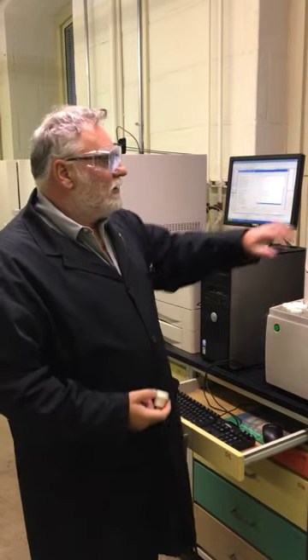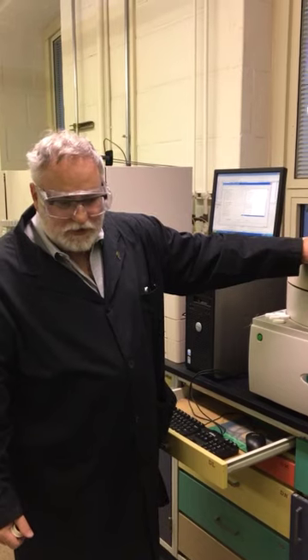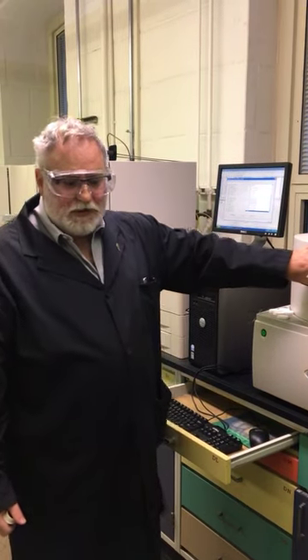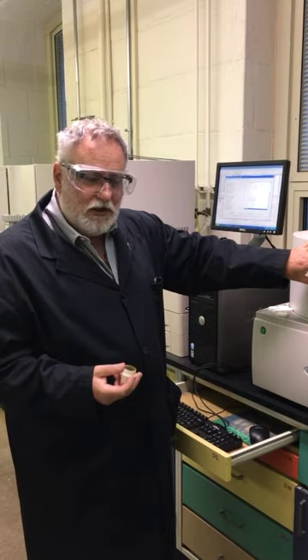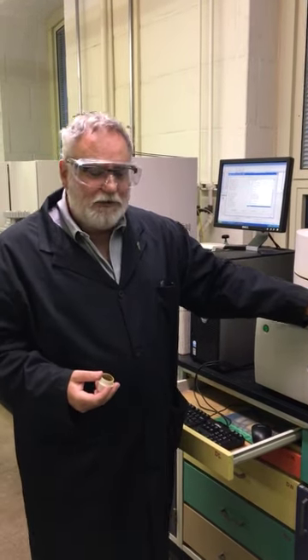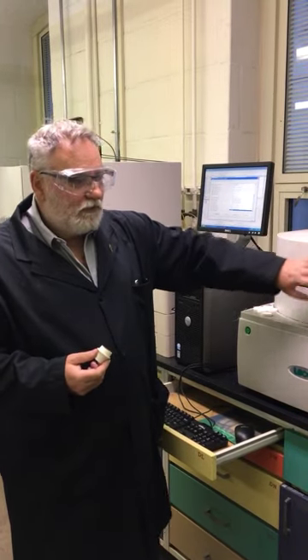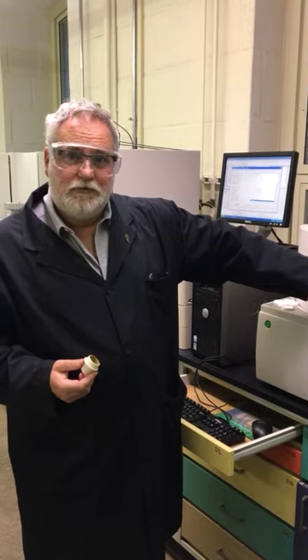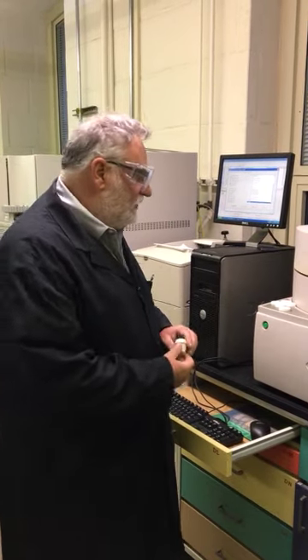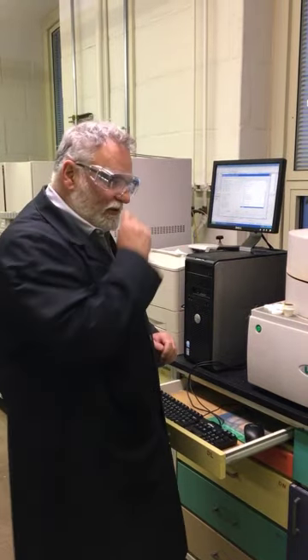Significance being that there's a mass gain or mass loss as the mineral matter transforms into ash in an oxidative environment. So moisture is done in nitrogen, volatile matter is done in nitrogen. When it reaches the appropriate temperature for that burn-off stage, where we're removing that fixed carbon, it's an oxygen atmosphere. So we determine moisture, volatile matter, ash yield, and fixed carbon is by difference. Oven cools down, samples are taken out, we reweigh new crucibles, and we go through the process again.